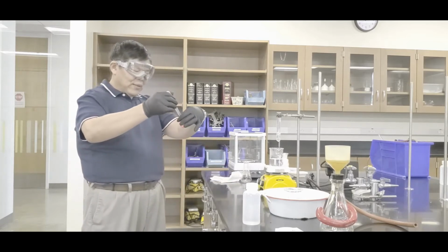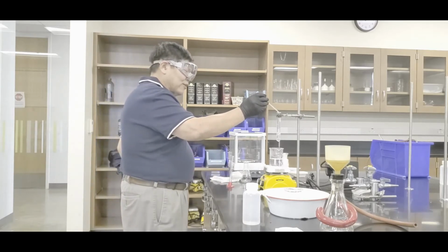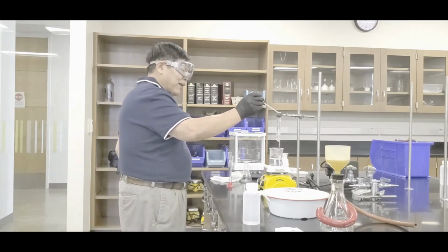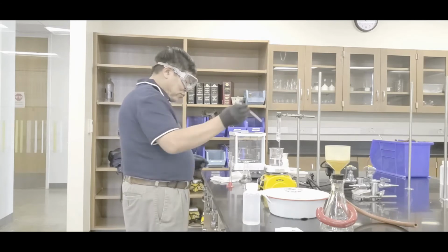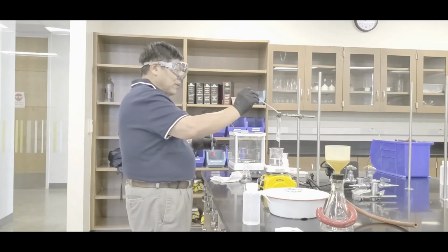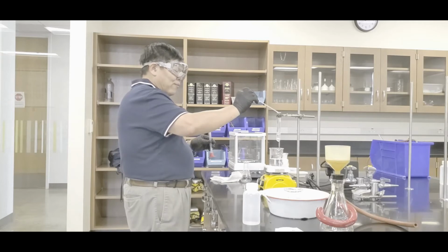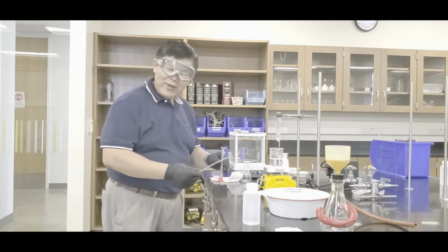So in that case, since I was able to do it, now move it at the same rate as last time. Here we go. Drop. But you notice that my hand is not over the test tube, understand? And pretty soon you'll get some white stuff coming out. That's your aspirin trying to come out. So here we go. I'm putting it in dropwise, and then of course the final one. Okay, I'm going to squirt, and then the last bit. There we go. I'm keeping my body away from this. Okay, so in that case we're good. Hey, not bad. No violence.